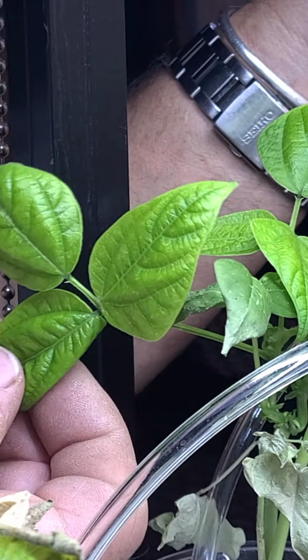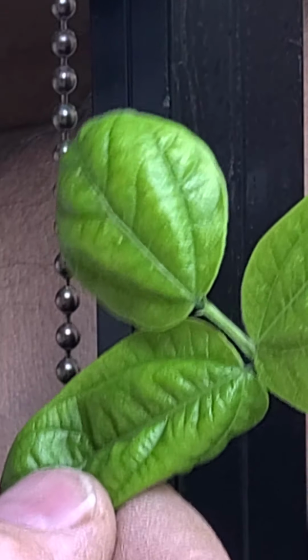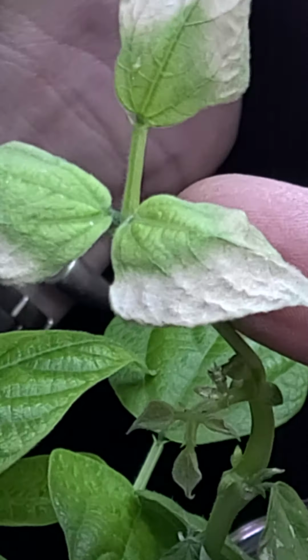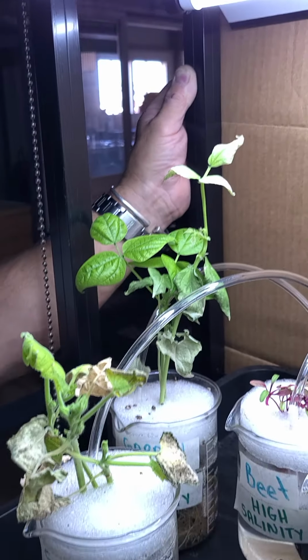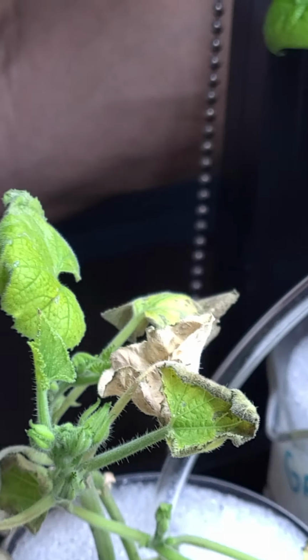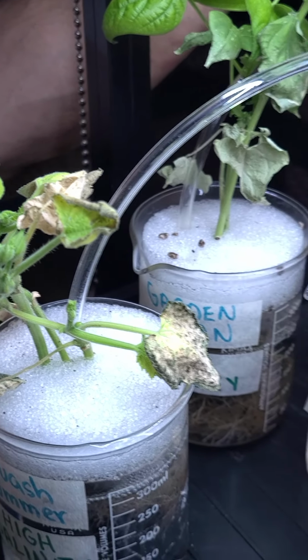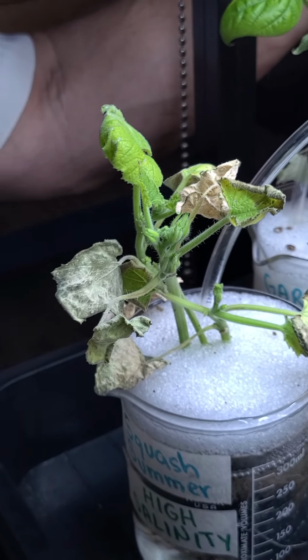These leaves look okay, but you do notice that there's a color issue on them. They look like they're starting to get a little yellow in them. These up here, those leaves have actually dried around the margins. And then finally over here on the summer squash in the middle, I don't really even need to say anything. This doesn't look happy. And if you remember the control versus the low salinity, there was quite a bit of difference there as far as the height and even how vigorous the plant was growing.